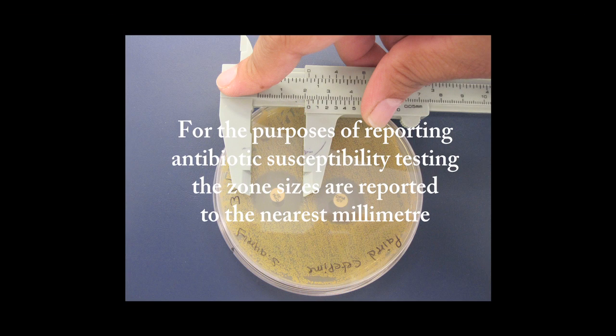For the purposes of reporting antibiotic susceptibility testing, the zone sizes are reported to the nearest millimetre.